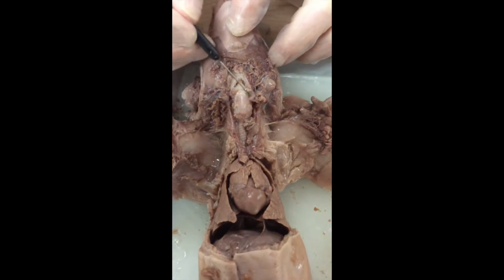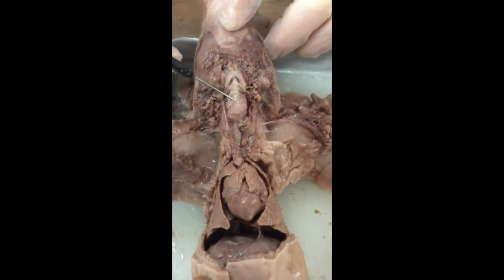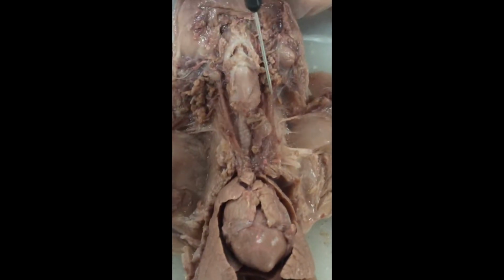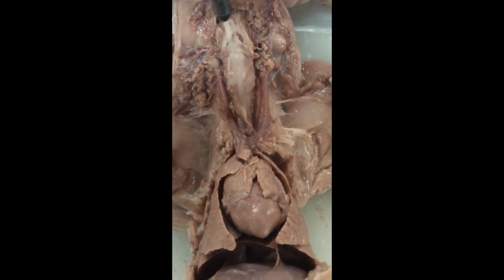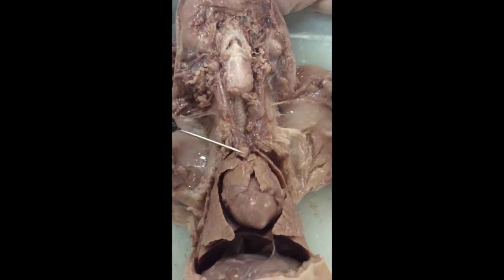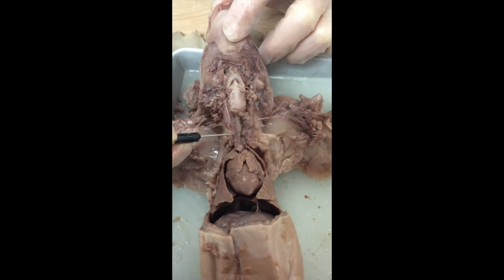Anyway, hyoid bone. We notice that we have an enlargement of the windpipe right here. In review, that's the larynx, also known as the voice box. In a little bit, I'm going to cut that out and we're going to look at the inside of that. You may recall that this is the thyroid gland laying right here, and we see below the thyroid and extending from the larynx on down to the lungs, this ring-shaped tube called the trachea.